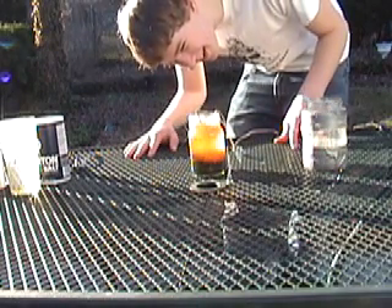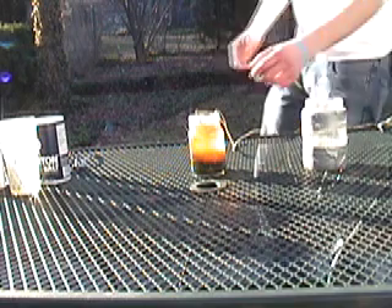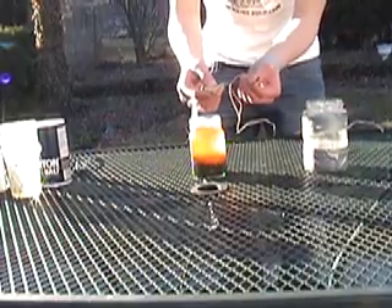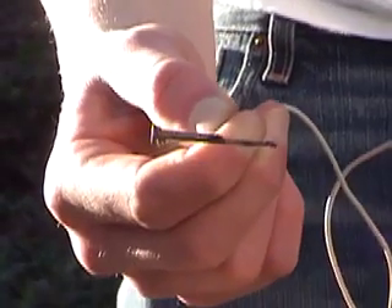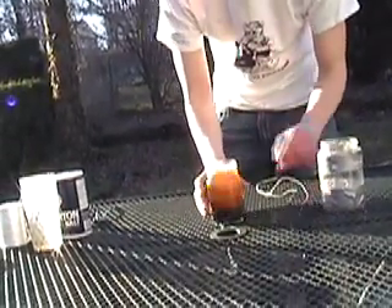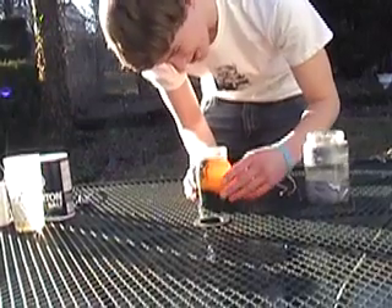As you can see, it's accumulated quite a good bit of rust. Let me just take this out. This is what's left of the nail — you can see it's mostly corroded, it's very thin. Right here we have the nail formation coming down — it's all rust.